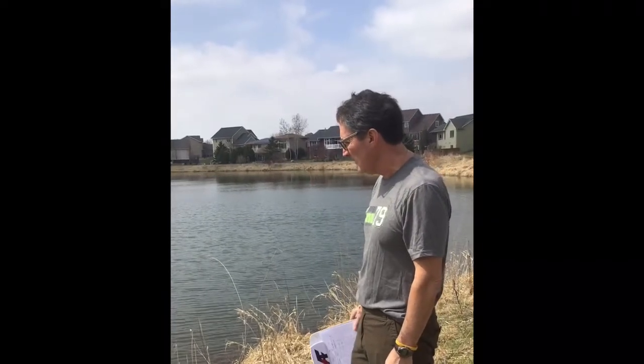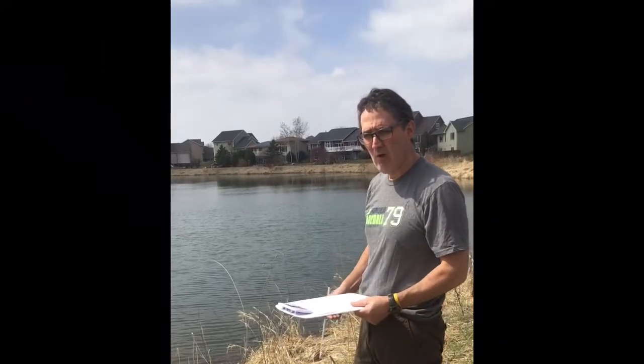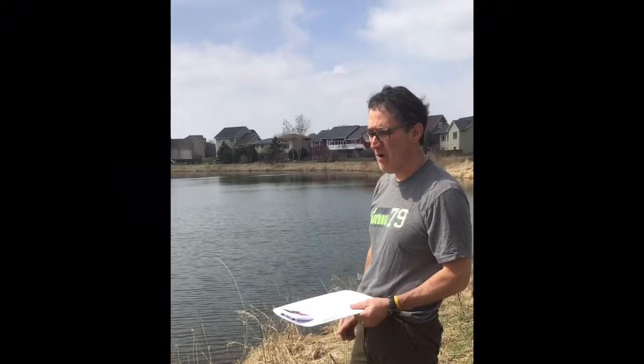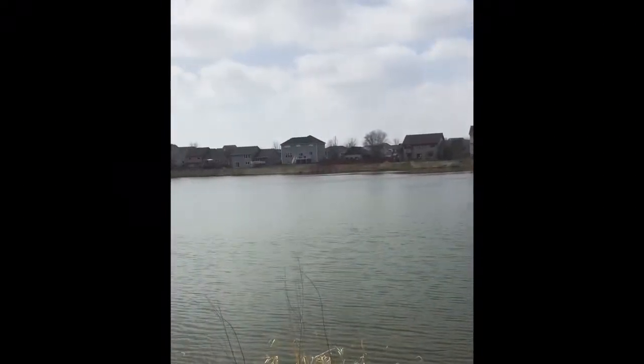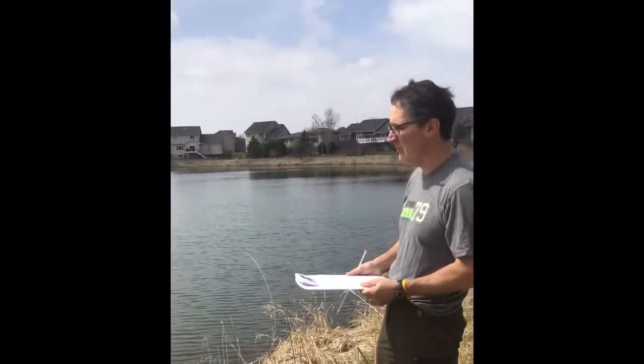Today we're on location at a pond right behind my house where we're going to get some water tests done. Some of the tests that you read about and did the water test case studies on are things we're actually going to test on two bodies of water. We've got the pond here, and then we're going to do some tests on a creek, which is obviously faster moving water than what's here.